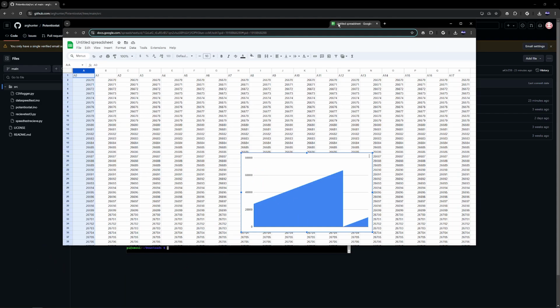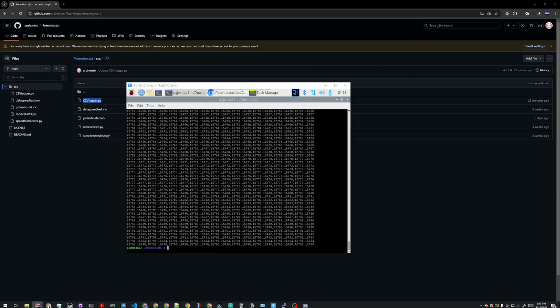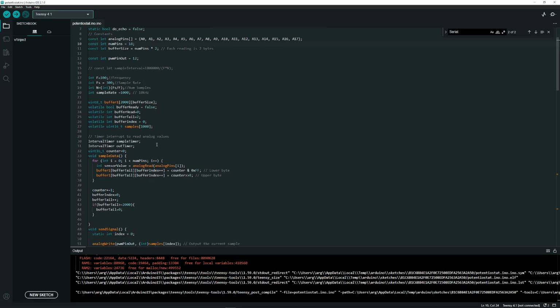Instead of sampling from the analog pins right now, what I'm doing is I'm running a counter in the background. That's just so I can verify that there's no data breaks or loss of data. As you can see, it's working pretty well. There's no errors. Now, to use this in a real application, with the actual data, what you have to do is change counter here to sensor value. But I haven't done that yet, as this is still a testing build of the potentiostat.